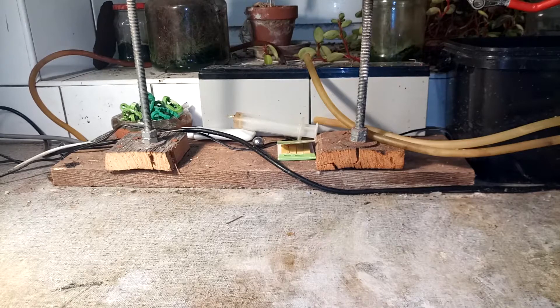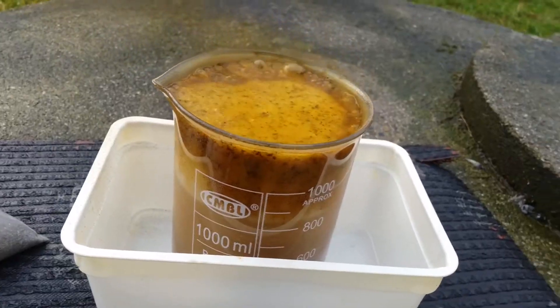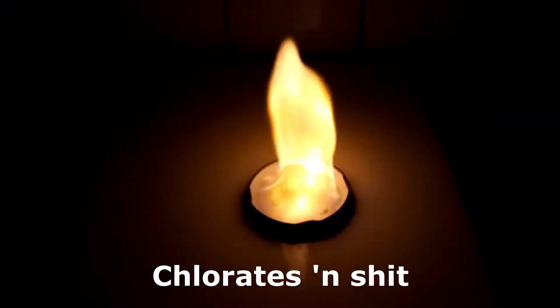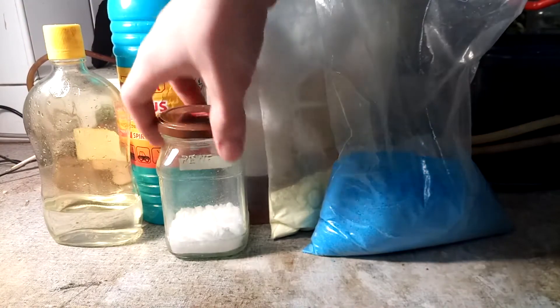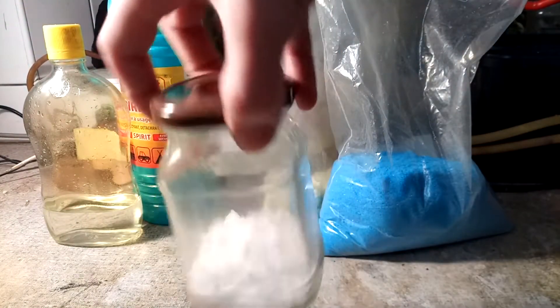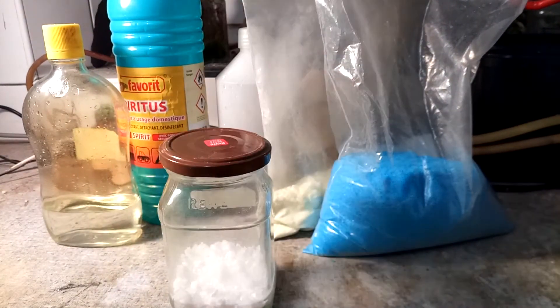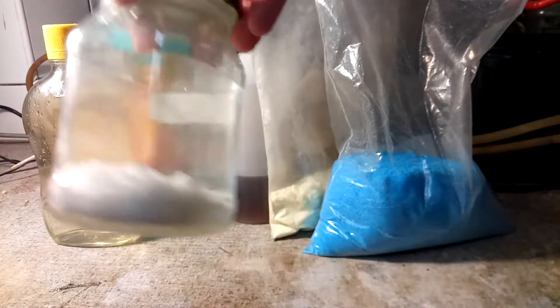Hey everyone, chemistry — specifically, chemistry with this beautiful white powder, which is sodium chlorate. I'm really just missing some fun little experiments I've always done, like electrochem and syntheses that are too complicated. So here we go, just doing some fun little experiments with chlorate.